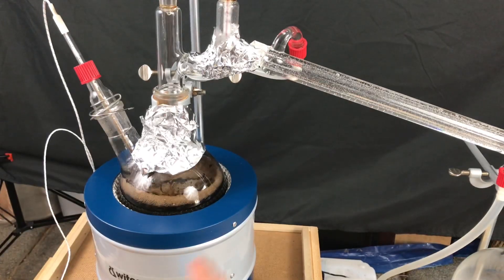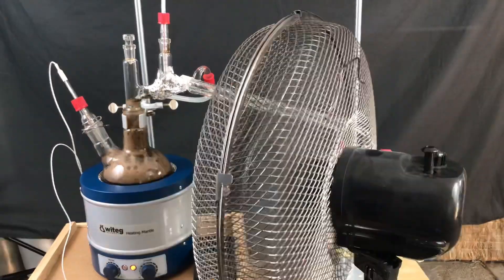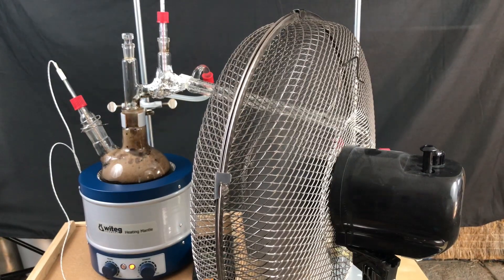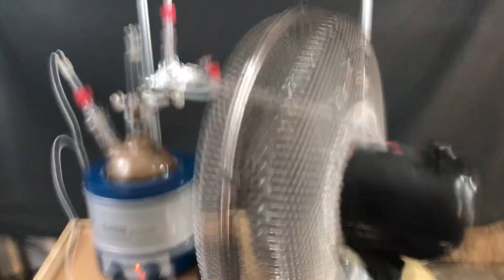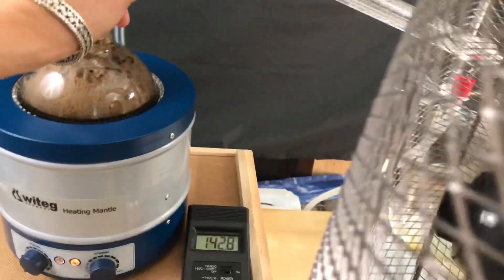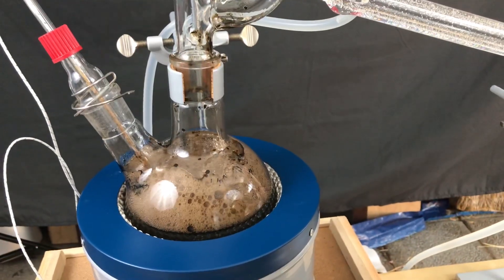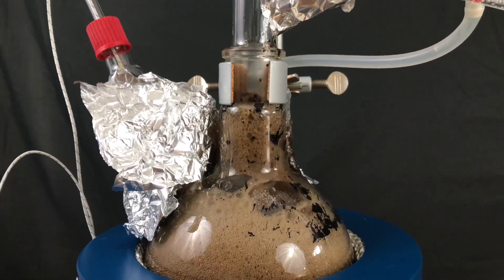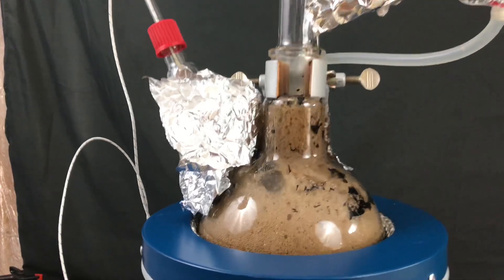The amount of foam in our reaction flask increased. Bubbling became such a huge problem that I added the fan to cool it down quickly and avoid any of our stuff in our heating flask to pass into our product. We don't want to contaminate it. Fortunately the fan was able to stop our reaction flask from overflowing.